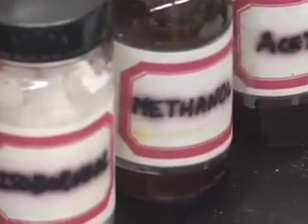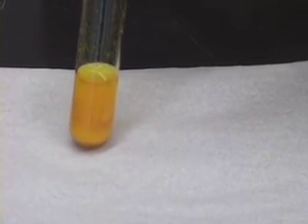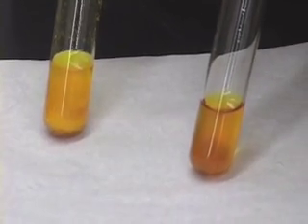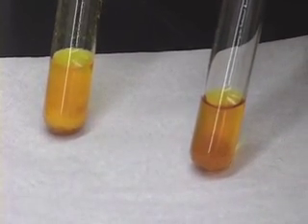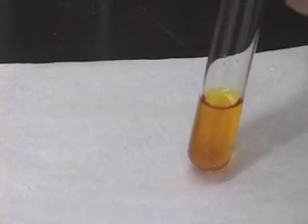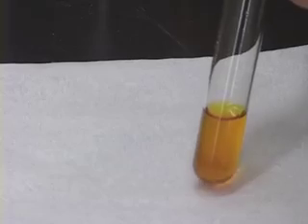Methanol, being an alcohol, is not supposed to give a positive test result, unlike acetone which gave us a yellow precipitate — a positive result. This is the positive test result from acetone, and this is the negative test result from methanol. Sometimes the reaction can be slow; if the compound is hindered, we may need to push the reaction by heating.